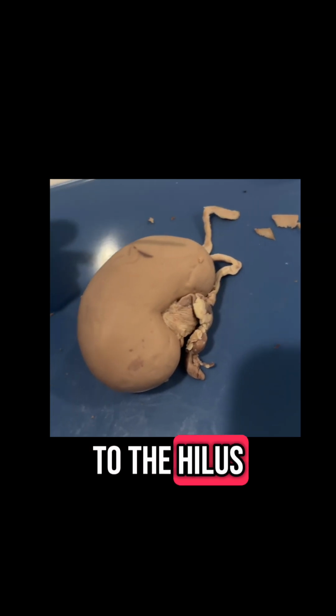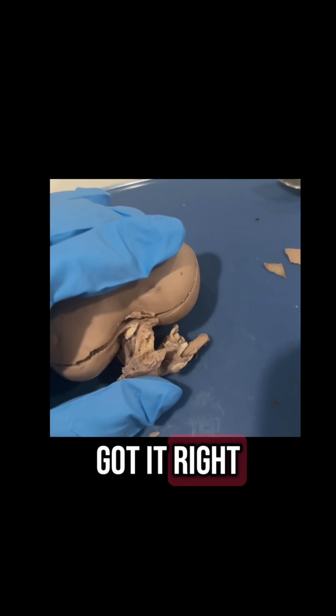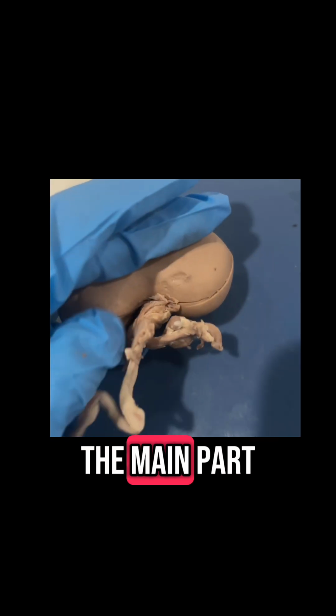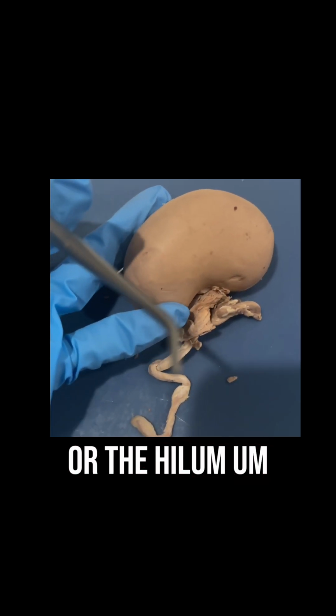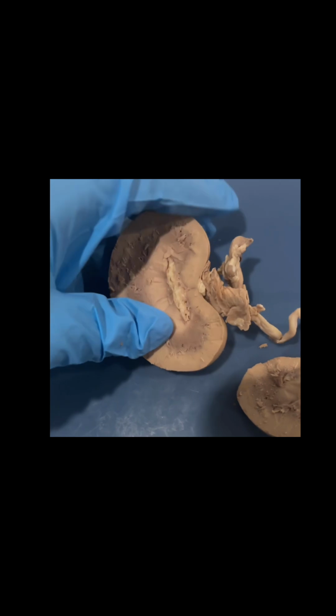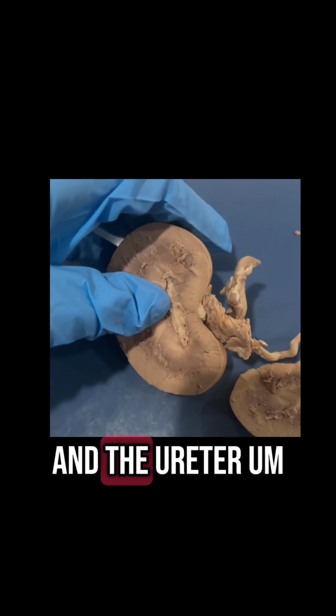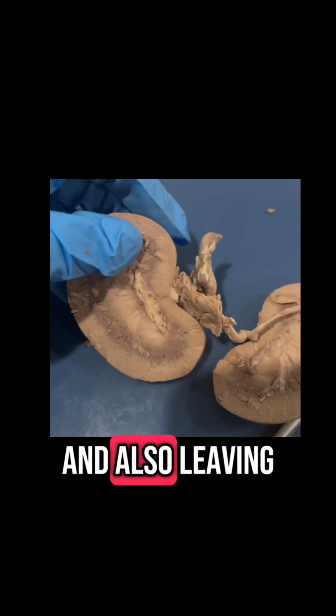Okay, next we're going to move on to the hilus, or the hilum. This is going to be this structure right here, where it's connected to the main part of the kidney. So the hilus is the indented part on the side of the kidney. I'm going to open it up here so you can see it better. This is where the renal artery, the renal vein, and the ureter pass through, and it's like the entry and exit point for everything coming in and also leaving the kidney.